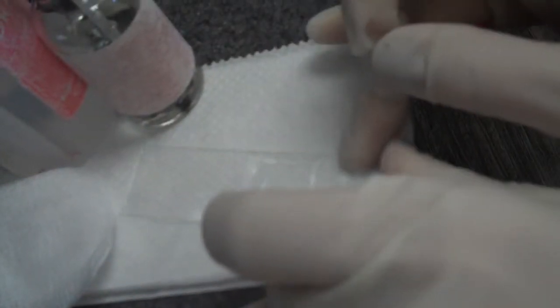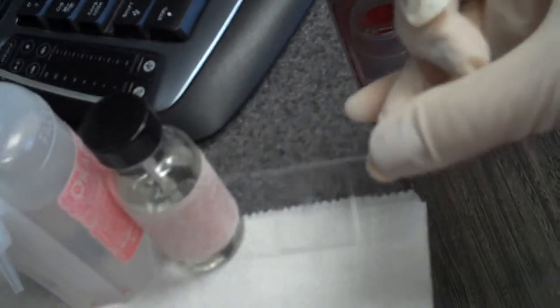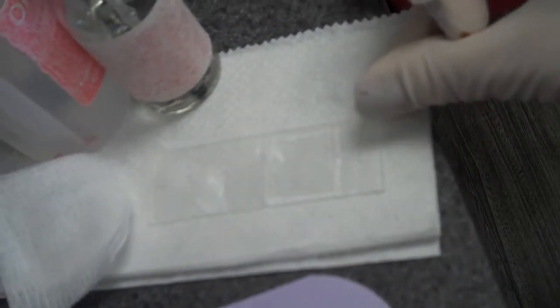I usually let it sit for at least 20 minutes. As it works out, I usually just look at this after I'm done cleaning the teeth. That'll sit for a while, and it'll kind of reorganize and get back to its normal behavior, and then we'll look at it later.